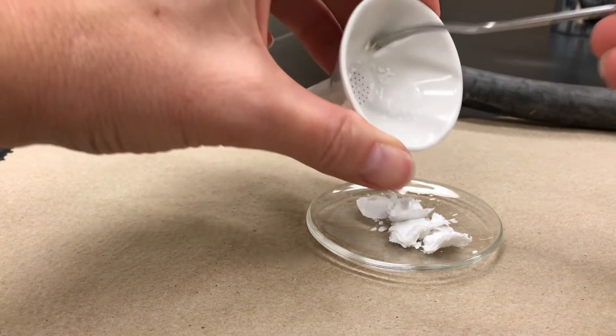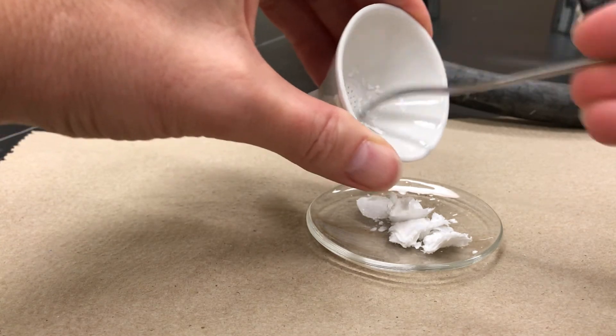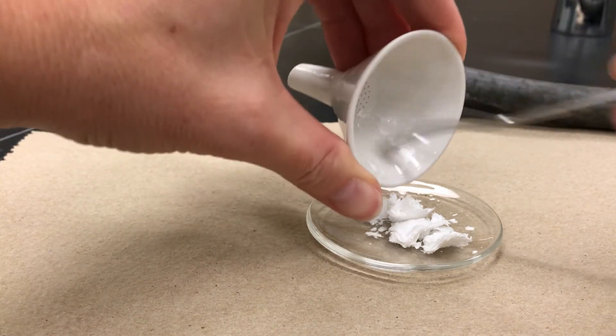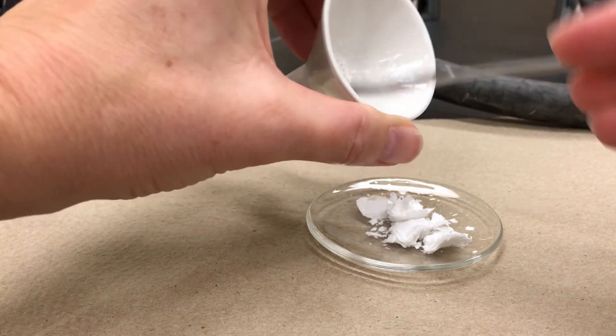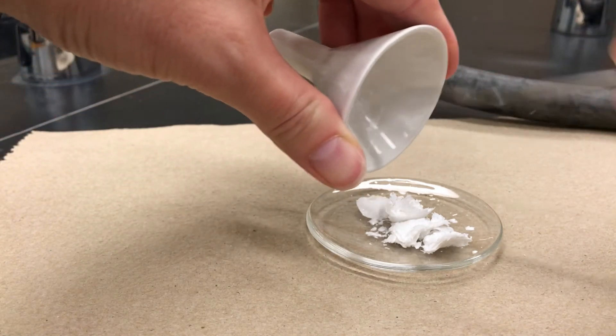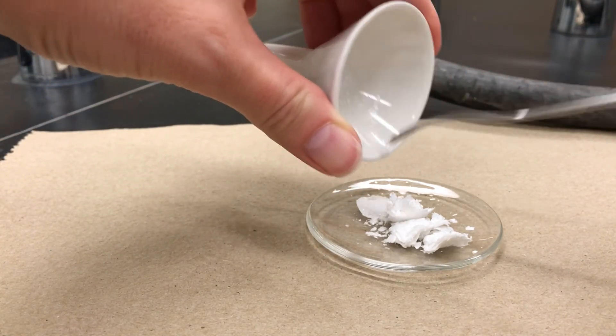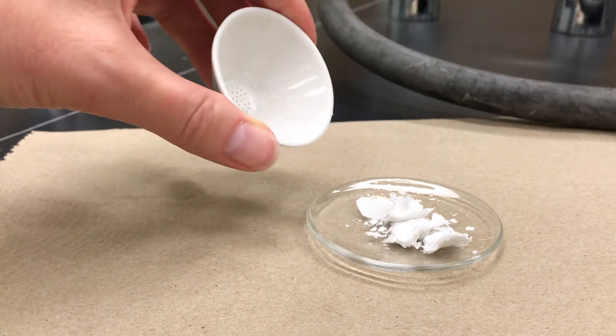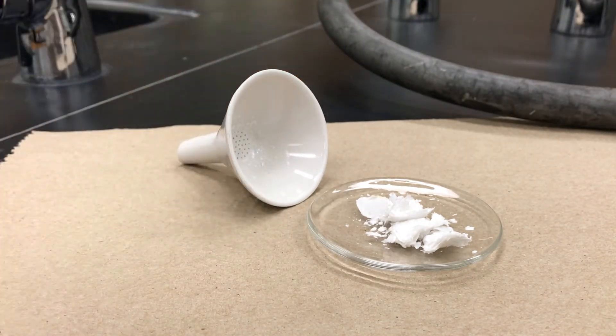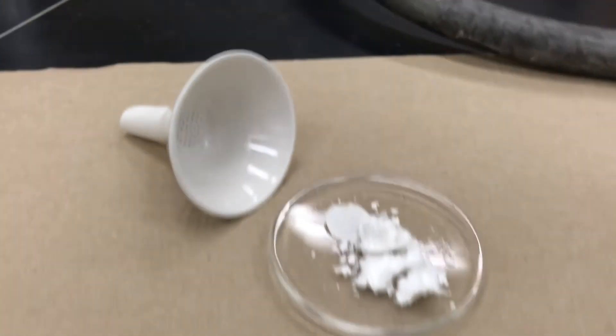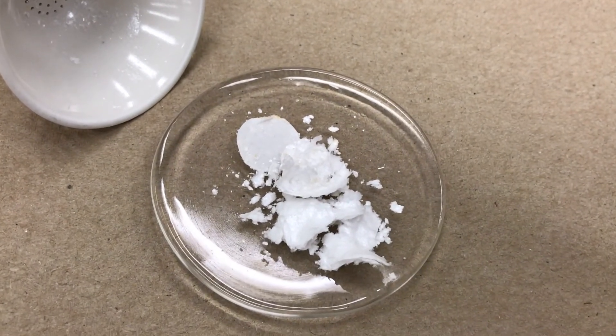You're going to set this aside, and often you let it dry overnight. And then the next day it's quite dry on the filter paper, and so it's a lot easier to scrape off the solid when it's completely dry. And that's the way that you use suction filtration to get a solid from a liquid.